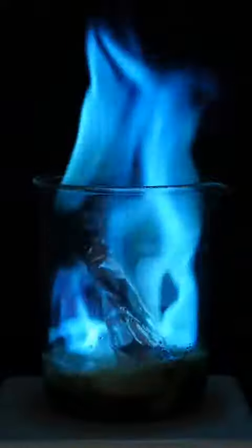This is happening because the acid and the aluminum are reacting to make hydrogen gas, and the color is coming from the copper ions.